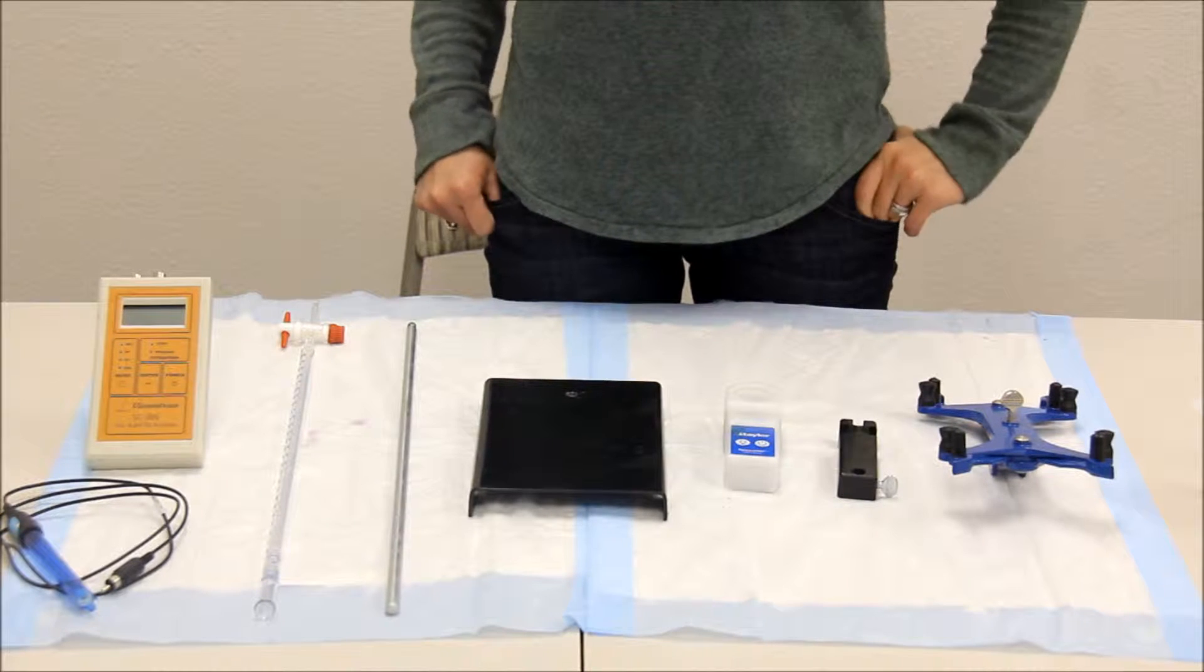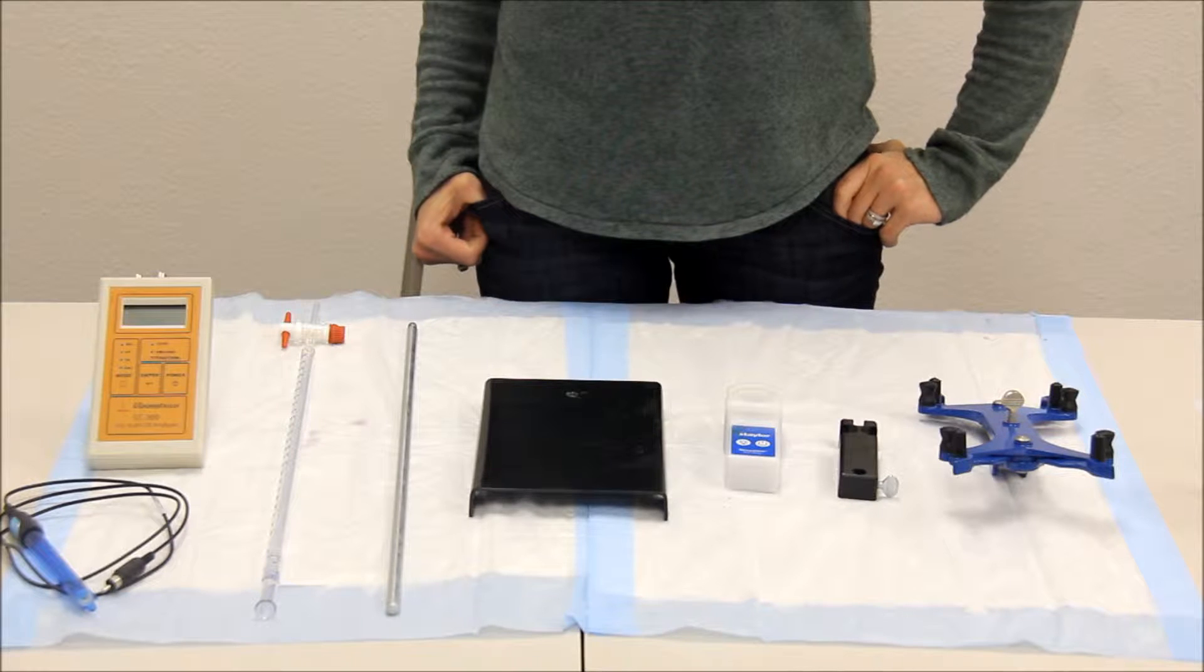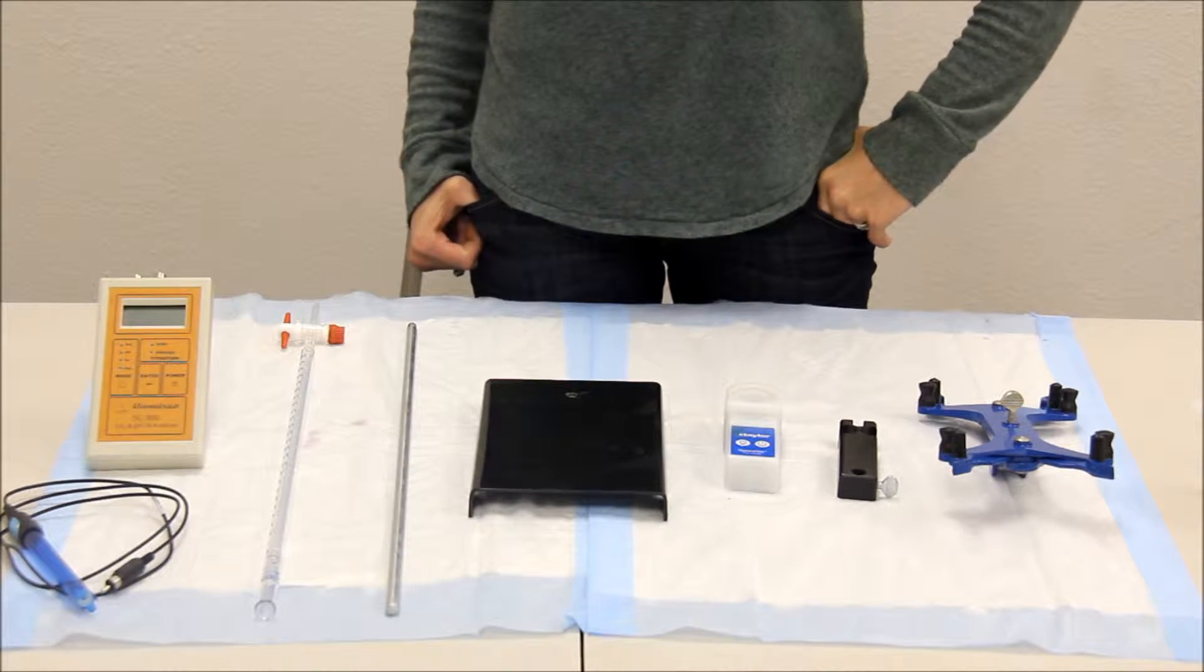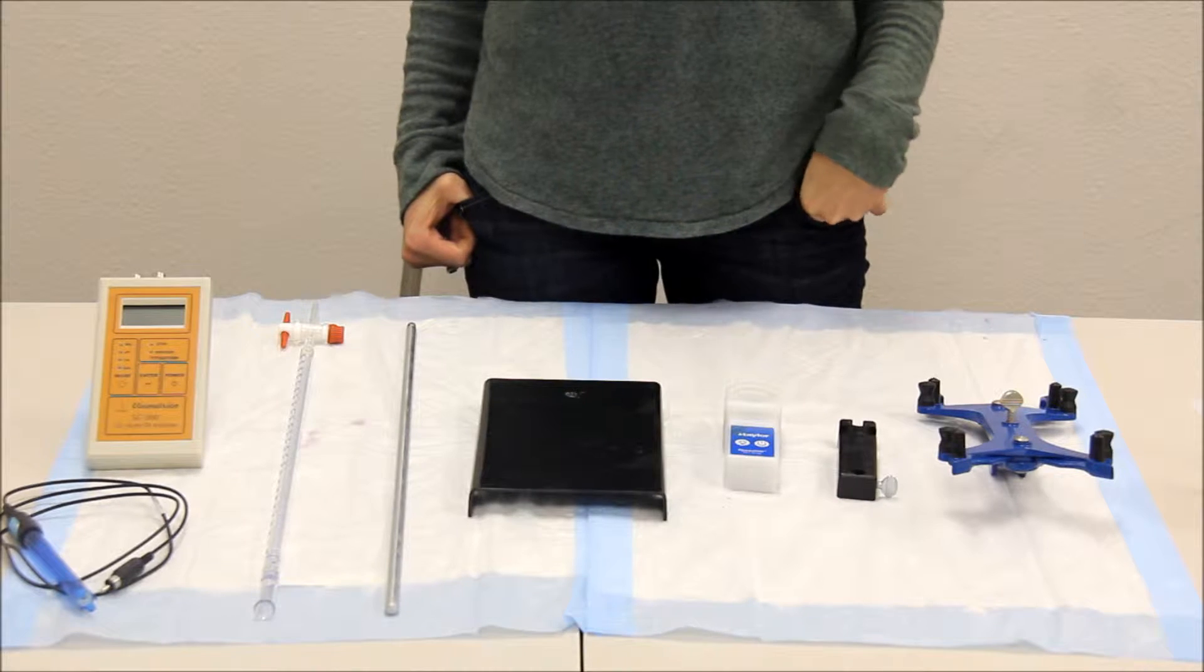This is how to set up your lab accessories provided in your SC300 Pro Kit and Deluxe Lab Accessories Kit.